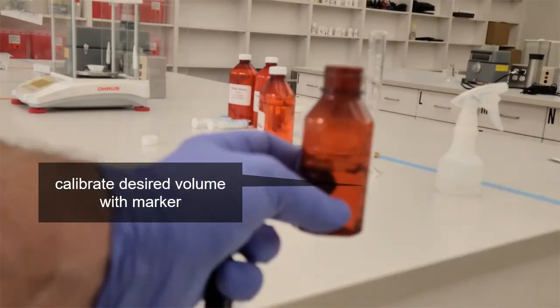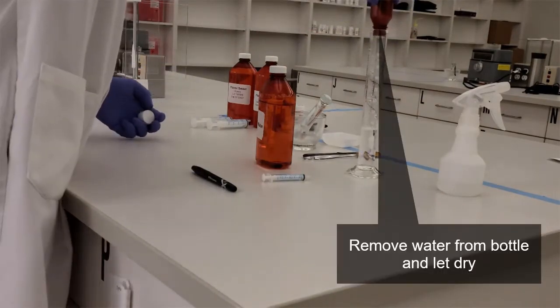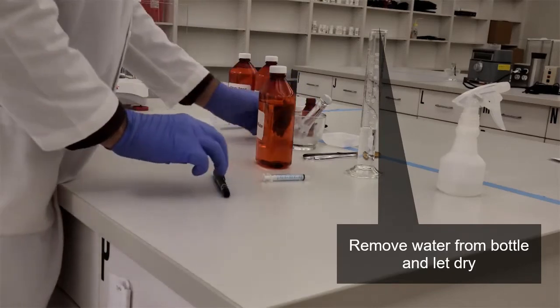So I'm going to make a mark on my bottle where my 35 mL mark is. Again, you are not measuring 35 mLs in your lab, but this is for a demonstration. And then you can discard that water appropriately.